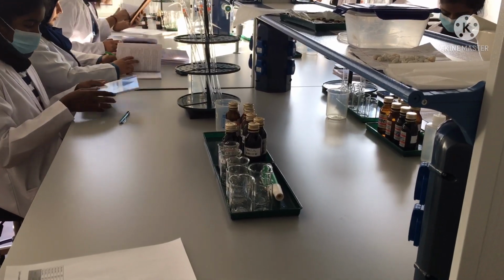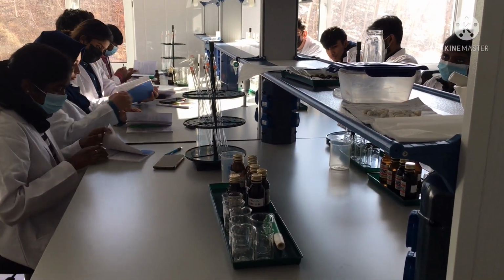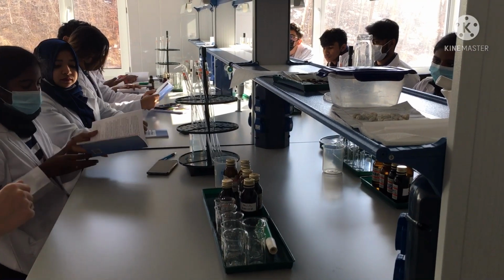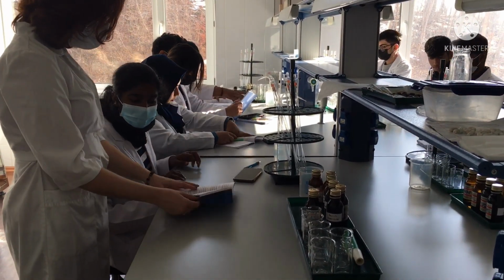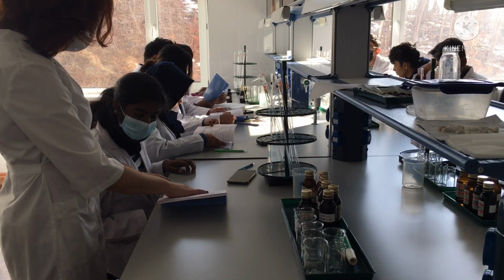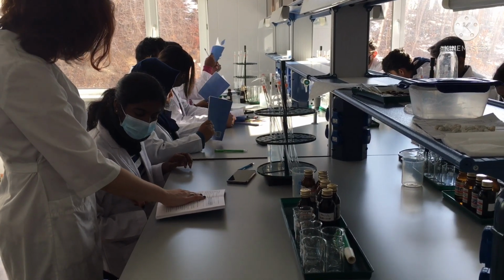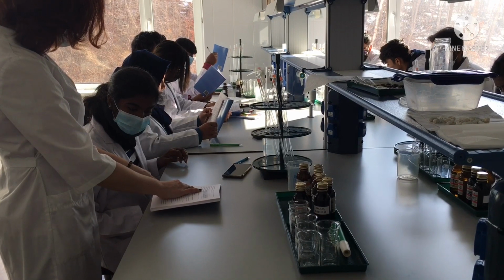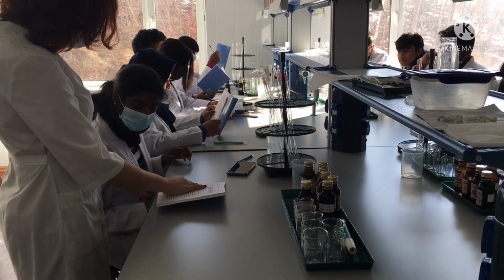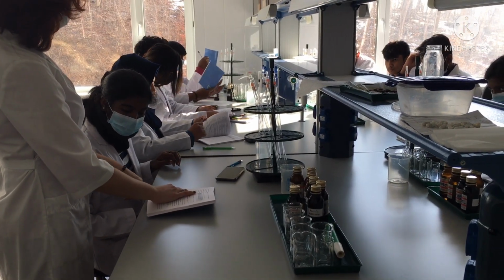Series of experiments where we study the influence of a catalyst. We will make 3 trials and we will mix the reagents according to our table. Volumes are noted in the table 2. As you can see, B1, B2 and B3 experiments contain the same amounts of all reagents, and also different volumes of copper sulfate. In the first trial we will add 1.5 milliliters of copper sulfate, in the second 3 milliliters, in the third 4.5 milliliters of catalyst.